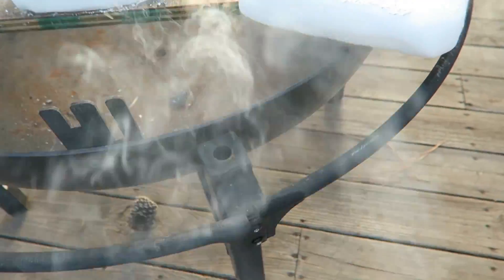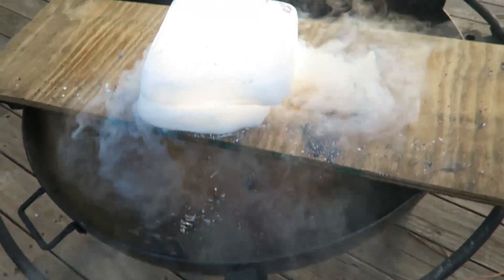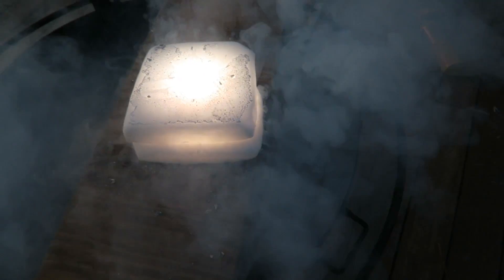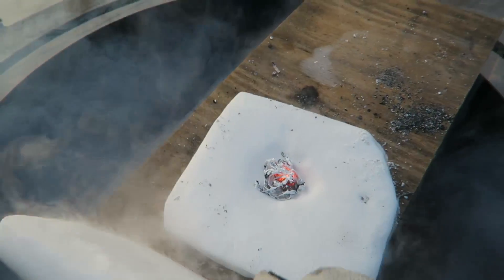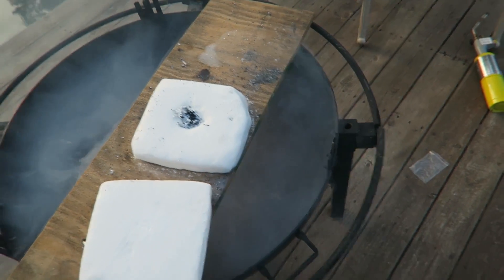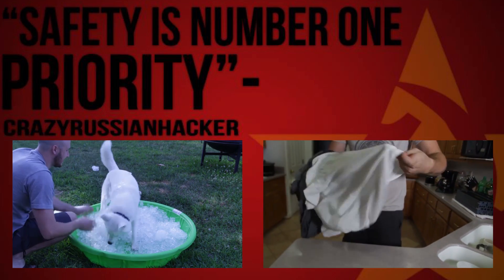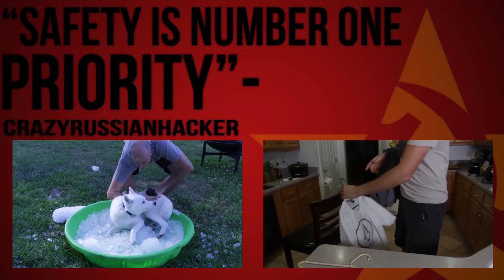Fire on fire — look, it's getting on fire. I'm gonna close it, and guess what, it's still burning. Look, it's so bright, it's insane — still not put out. And finally it's done. Look, it's all burnt out. Isn't that crazy? Super hot. Fire on fire — and just like that, we're done. Thank you!